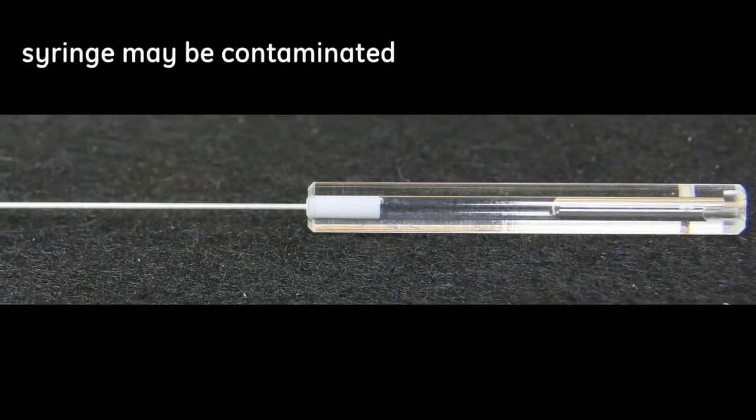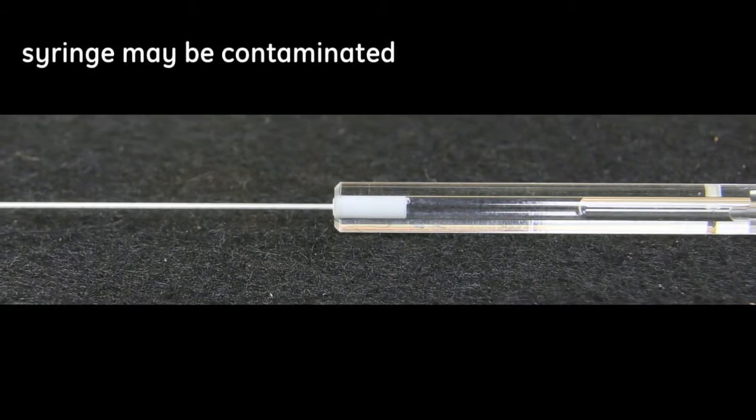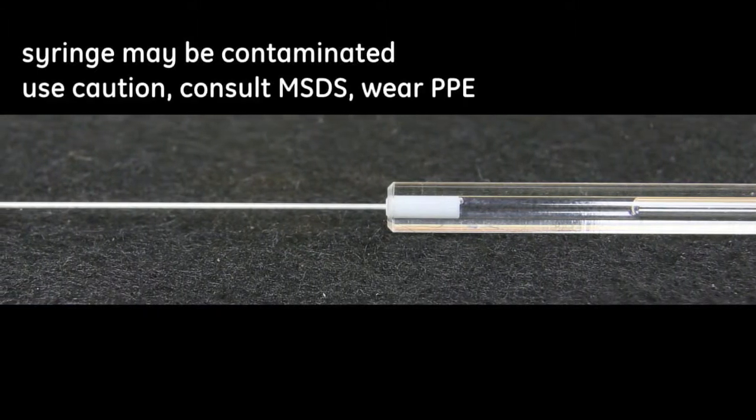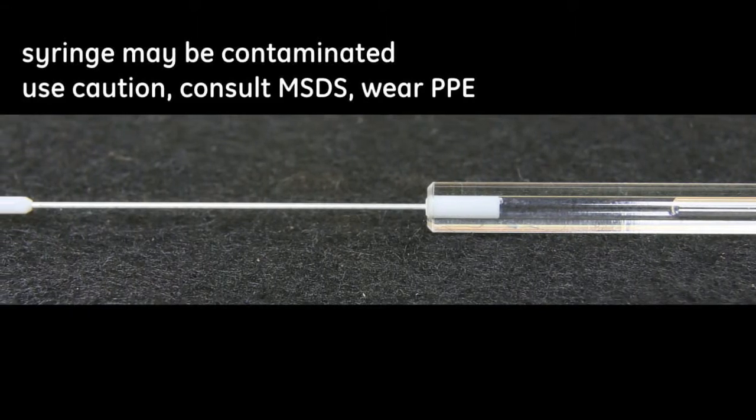Be aware that the syringe may be contaminated with hazardous residual substances that have been used in the instrument. Use the appropriate personal protective equipment as specified in the MSDS for those substances.